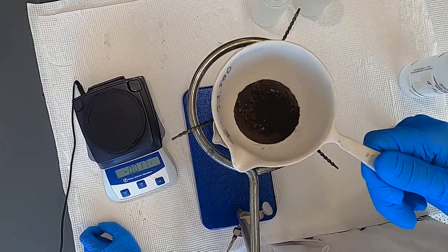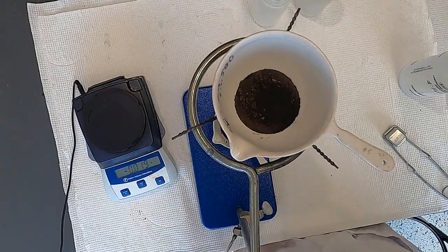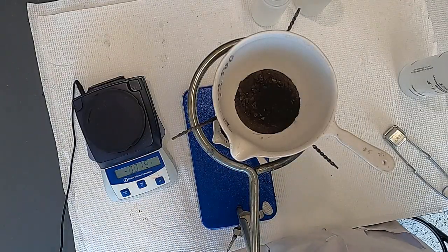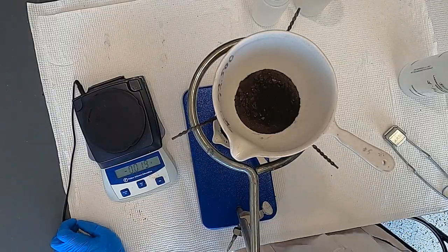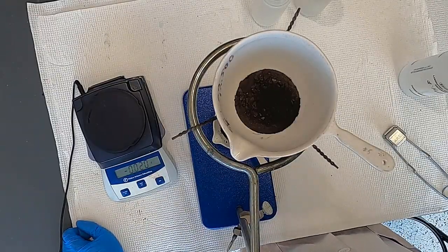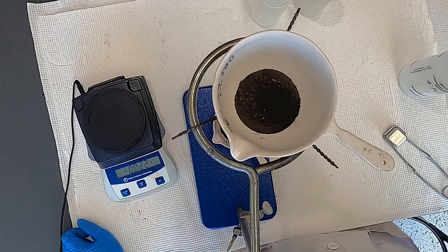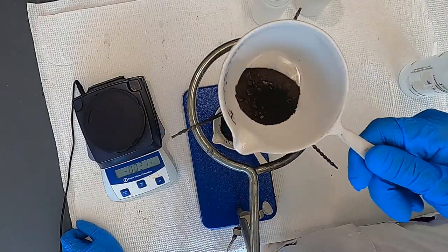It looks just like the stuff that you received at the end of part 1 or experiment 1, where you took copper over heat to obtain copper oxide. Here we did it in a multi-step synthesis fashion, where we went from copper sulfate pentahydrate via base to a copper hydroxide, filtered, decanted, or otherwise I centrifuged it, took away the mother liquor that's going to have some other salts in it. I've got the copper hydroxide isolated, we just heated that up, and now I've got copper oxide.